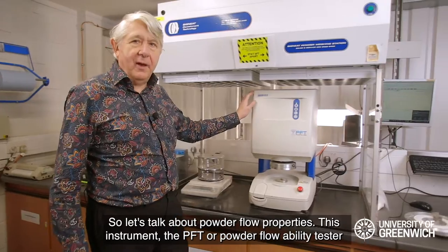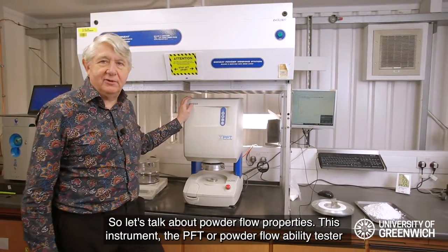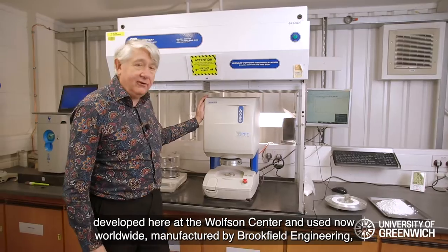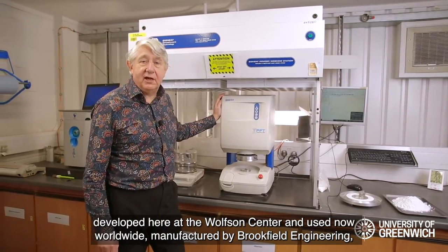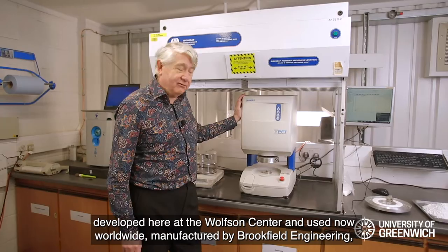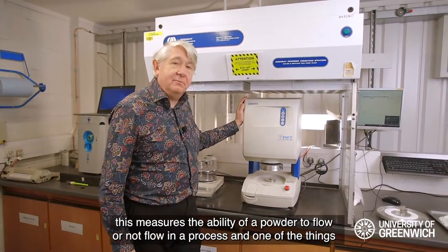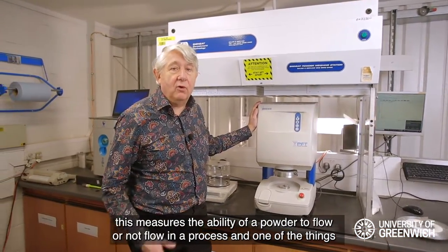Let's talk about powder flow properties. This instrument — the PFT, or Powder Flowability Tester — was developed here at the Wolfson Center and is now used worldwide, manufactured by Brookfield Engineering. It measures the ability of a powder to flow, or not flow, in a process.